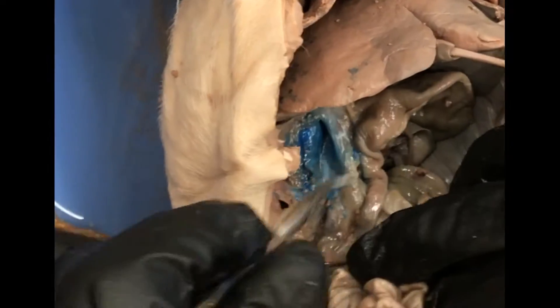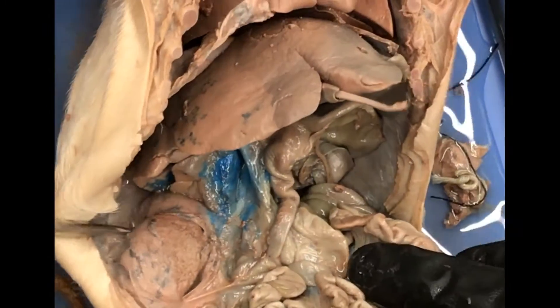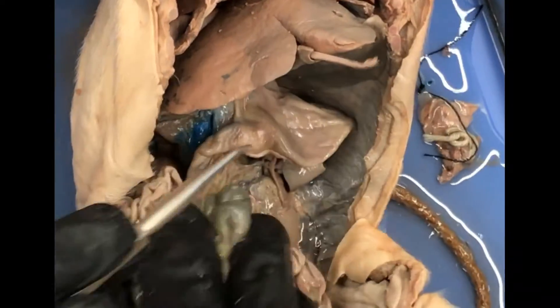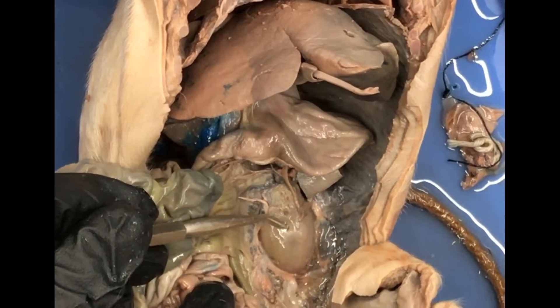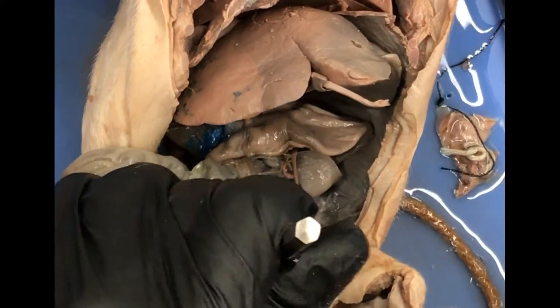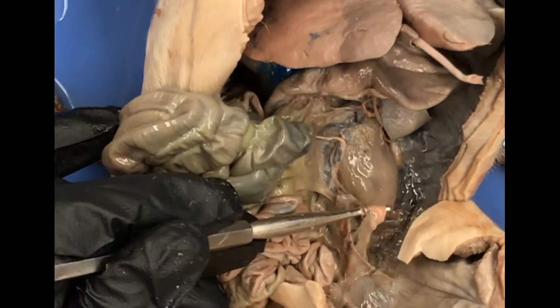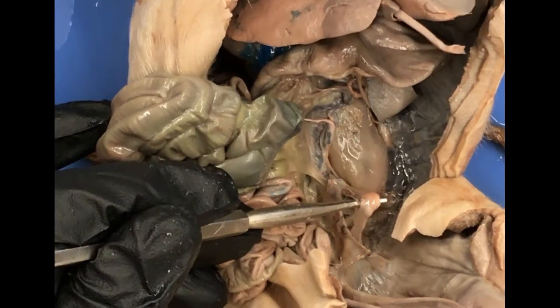We can see the inferior vena cava back here. We can see a kidney right there, and there's going to be another one on the other side. All you have to do is pull stuff aside — you don't have to take it out — you'll find it. There's a tube leaving the kidney heading inferiorly; that's the ureter heading towards the urinary bladder.